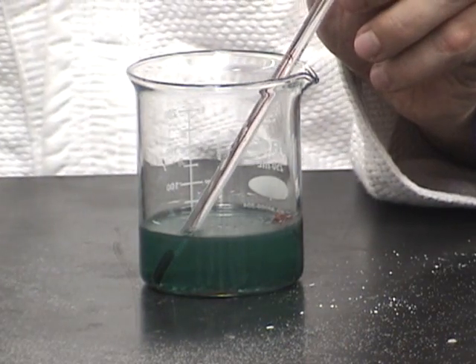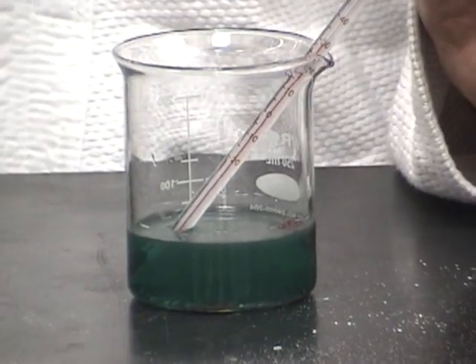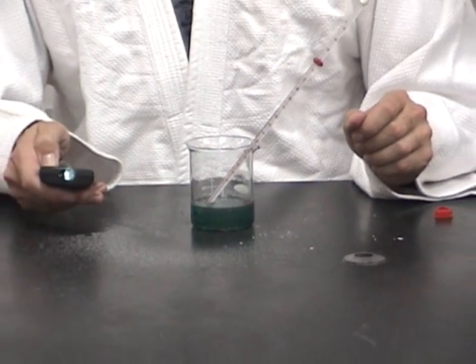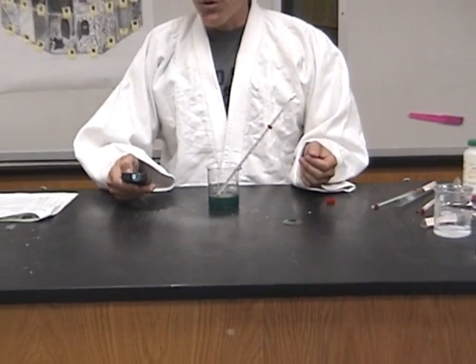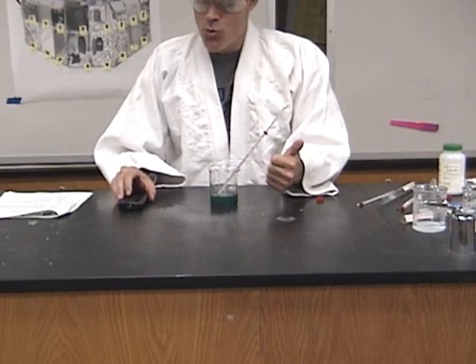And the reaction, I already know ahead of time, will end up getting up to 30 degrees Celsius. But the big ideas of what I want you guys to get from running these four reactions would be that there are four main indicators of a chemical reaction, that being that there can be an increase or decrease in temperature. Come on back out further. An increase or decrease in temperature.